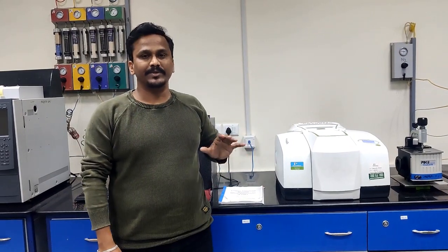Demonstrate FTIR instrument. FTIR instrument is basically used to find out the functional groups or chemical bonds of the material. Before starting the sample measurement, I'll explain the complete instrument setup. Then after that, I'll explain step by step the sample measurement.